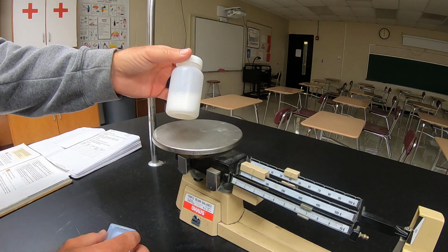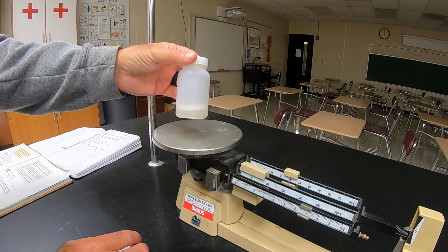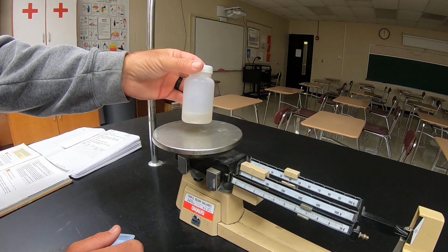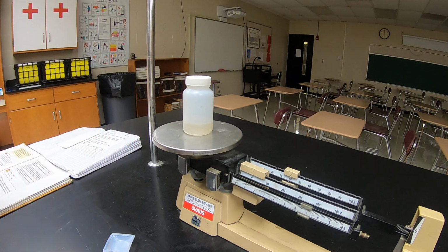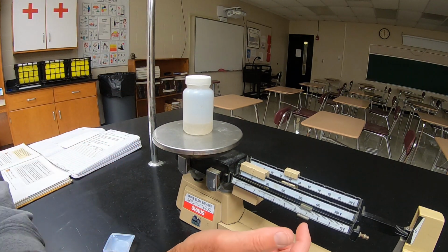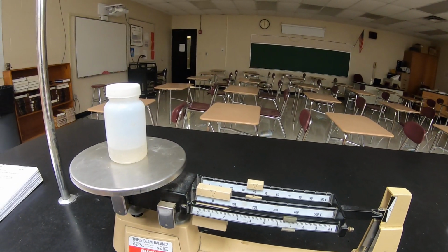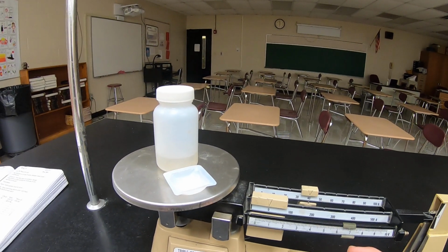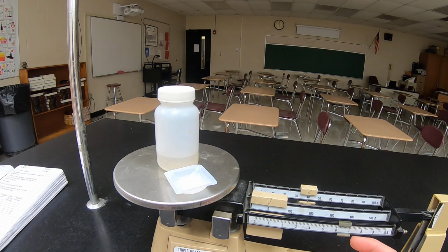And we're going to let it go here for a couple minutes. I probably won't even need to go a couple minutes. Looks to me like it's done. You can see it's done fizzing. So I'm going to set this back on there. And I need to make sure I include this too because that was on there the first time. And you can see that we lost a little bit of mass, probably because I didn't get the lid on quick enough.